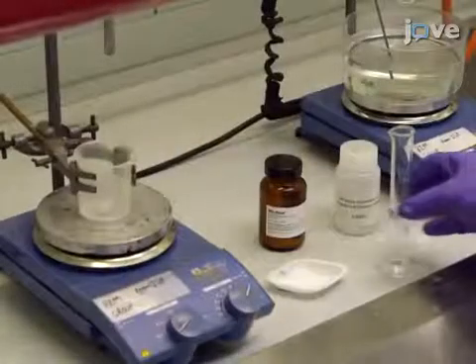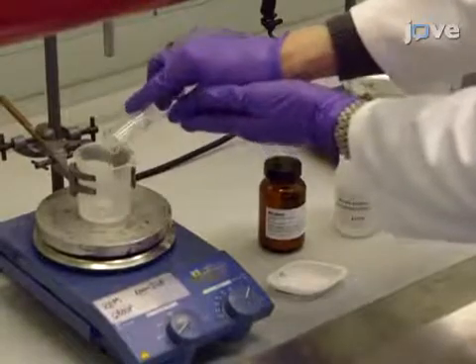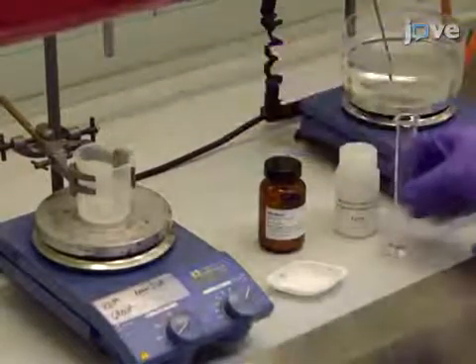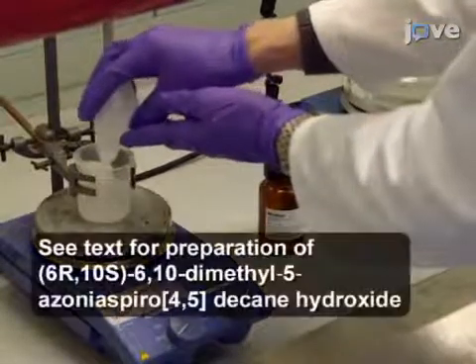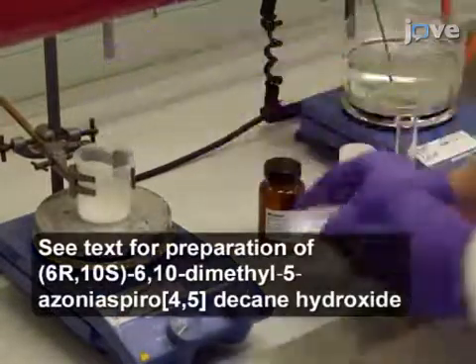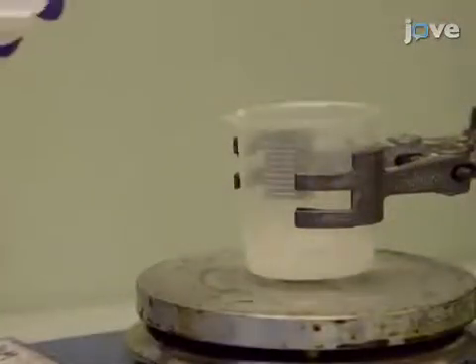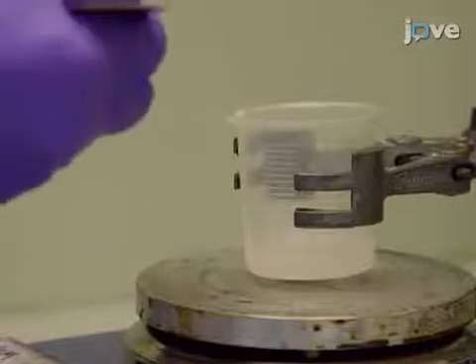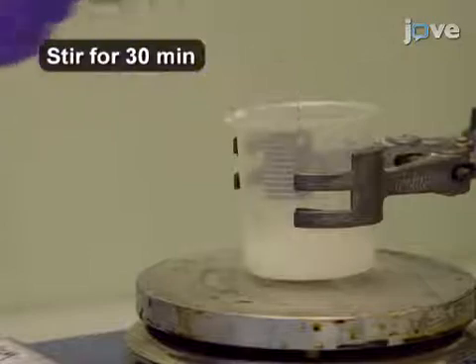To assemble the parent germanium UTL zeolite, first dissolve 1.08 grams of germanium dioxide into 15 milliliters of a solution of the structure-directing agent. Add 1.246 grams of fumed silicon dioxide portion-wise to the solution and stir for a further 30 minutes until a homogeneous solution is formed.